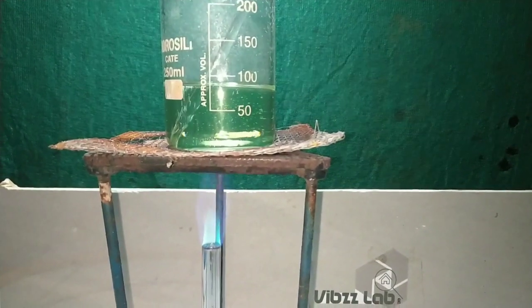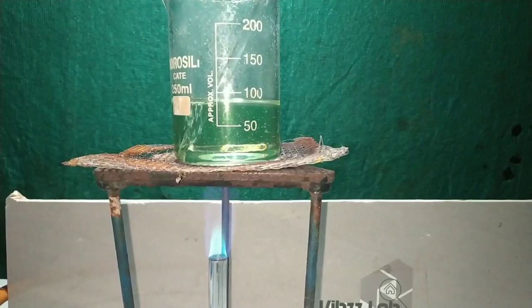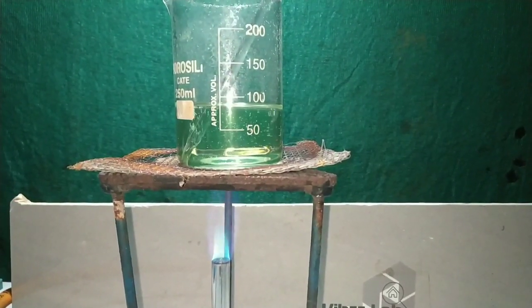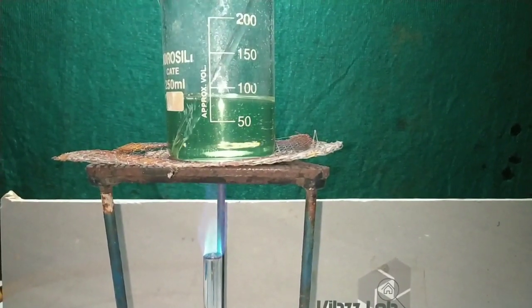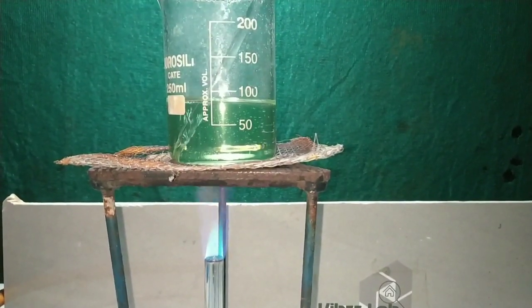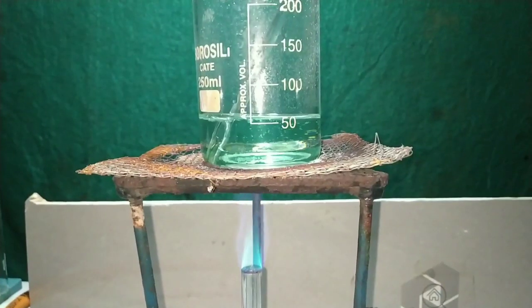Here I have about 100 ml of solution which after 30 minutes has reduced and the solution has turned clear. You can see some green color to the solution which means even after all that thorough washing, I still have contamination of copper.